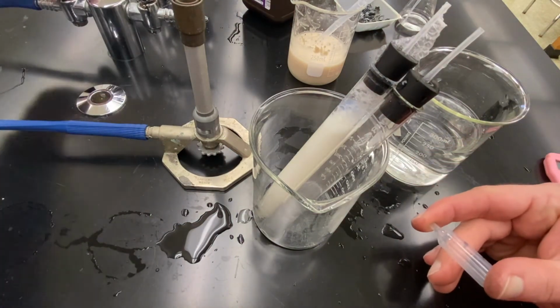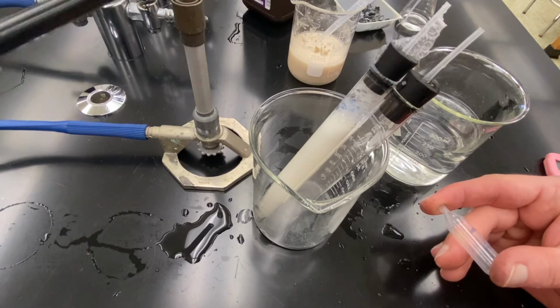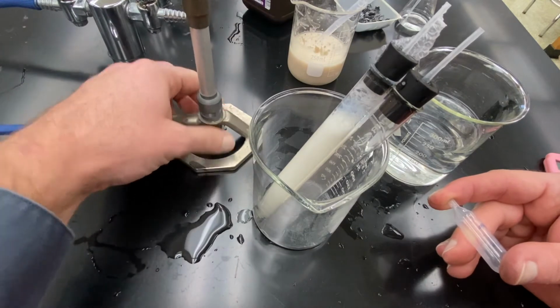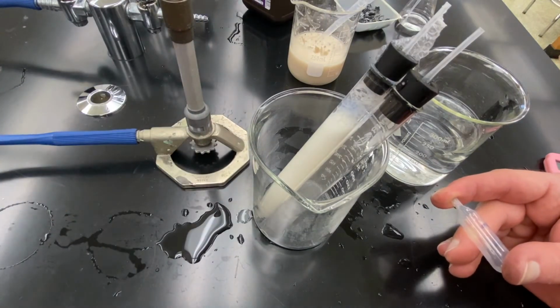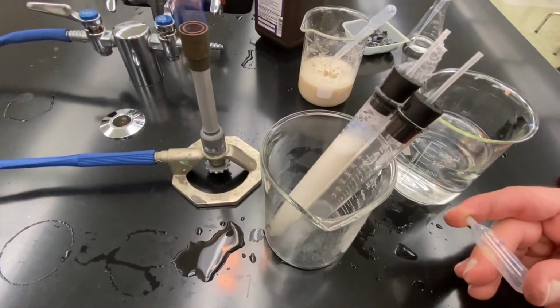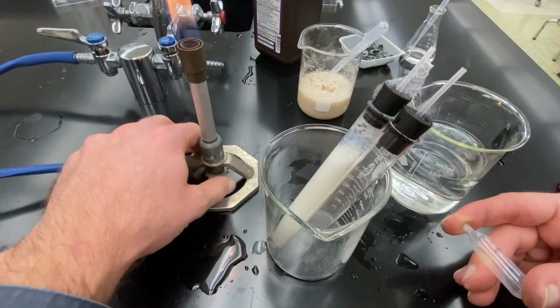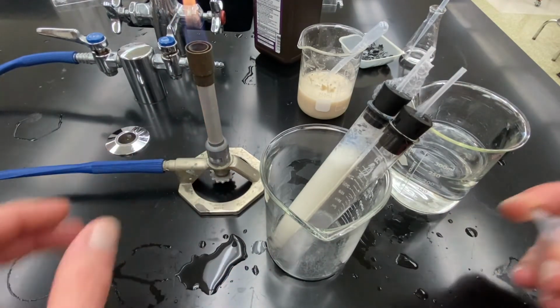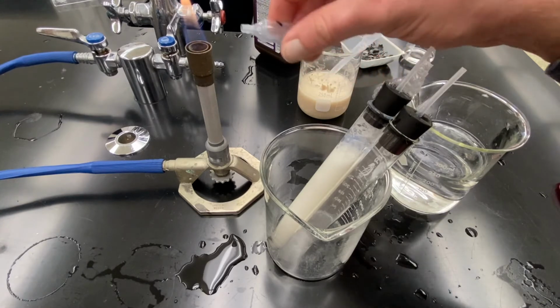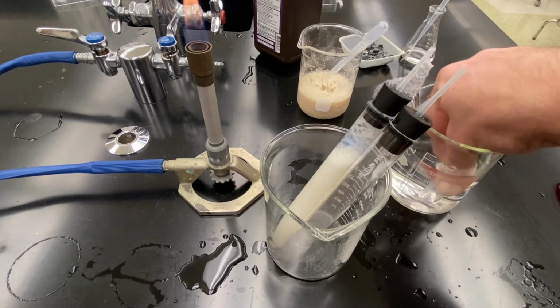I'm going to turn on my gas burner, and my valve is off on the bottom. So there I have my gas burner. Move my camera a little bit, turn my gas down. And I want to test the combustion of this hydrogen. So I'm going to squeeze the gas into the flame. I got a small pop noise. So I'm going to fill this back up.